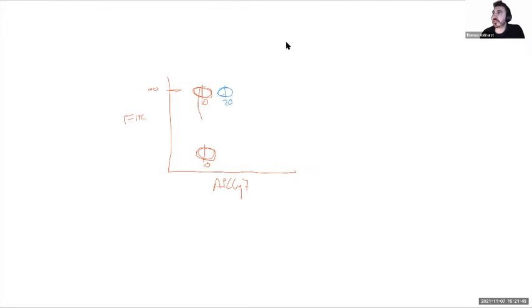If we had the population sitting over here, the value would be higher still in terms of the ratio of this to this. Now, the issue is that if we get a negative number, by definition, for it to be negative, this population has to actually appear over here for it to be a negative ratio. So to have compensation of 0 or 1 or 2 or 5 or 10 or 50 or 100 all makes sense, and it all involves populations being on the right here. For it to be negative, a population had to appear here, which really just isn't possible. At a minimum, if there is no spillover, it would be the same as the negative.